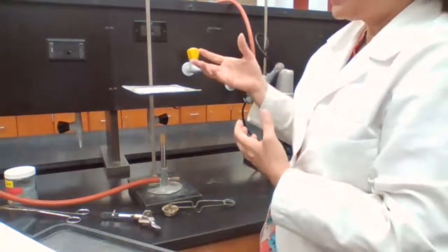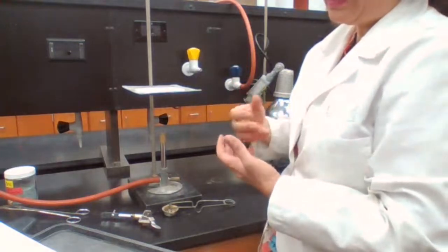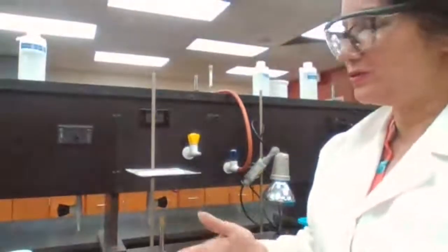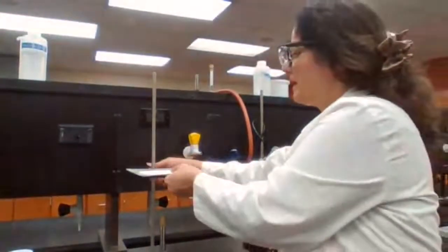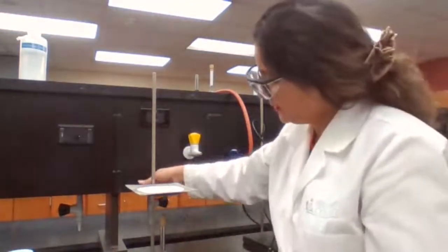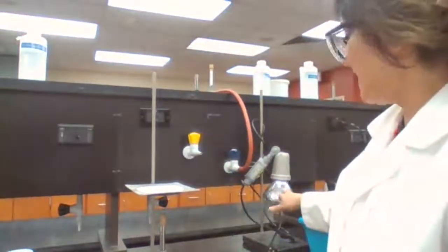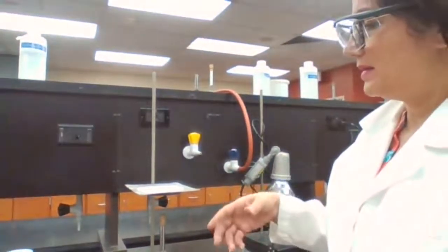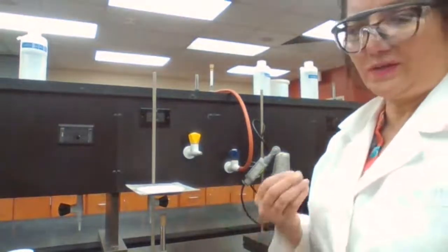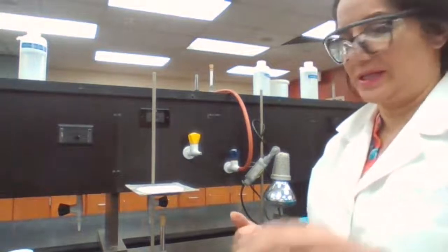The solvent evaporates, so what is left would be a white powder of zinc iodide. That is the product that we are going to recover for part 2 of the experiment. And the zinc that is left over, we are going to dry it using the heating lamp and measure the mass again in order to find how much zinc was left as unreacted zinc.